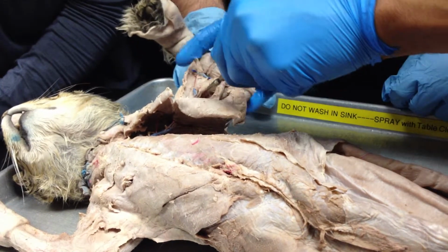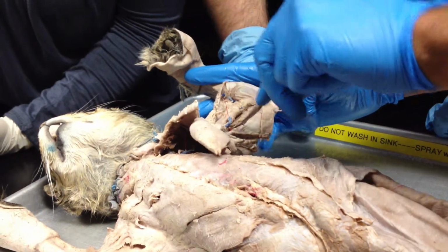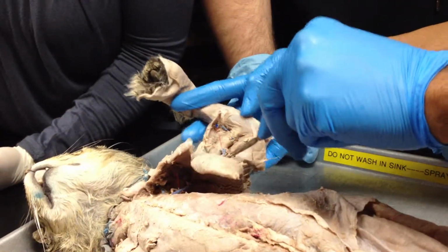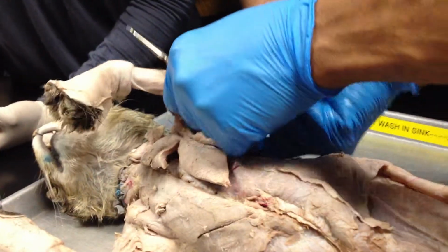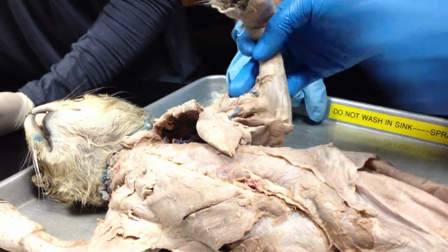So as you cut this deltoid muscle here, then below it we have the biceps brachii. So that would be one of the heads of the biceps brachii. And then down here we have the triceps. Okay, so we can see here triceps are much bigger. It's made of 3 heads. So medially that's one of the heads, and then you have the second head here, and then between them there's the long head. But all this down here would be the triceps, and then deep in here would be the bicep. Okay, so those are the 2 muscles we needed to know there.